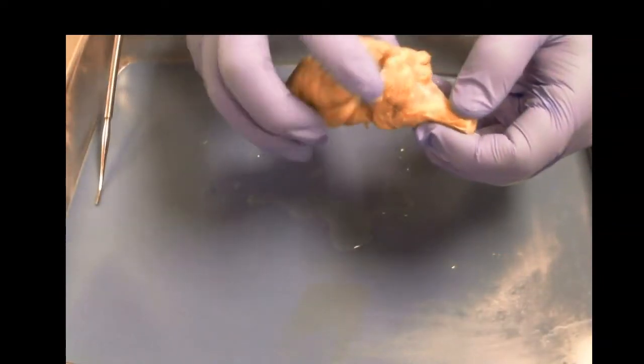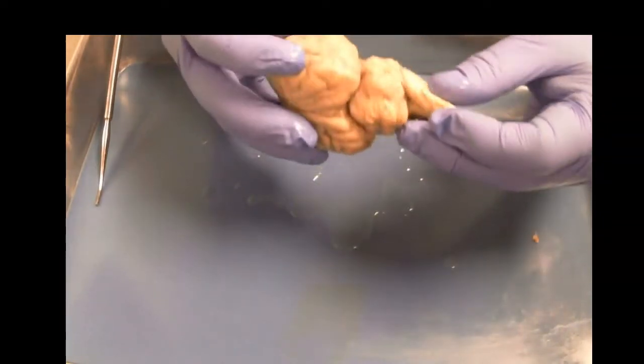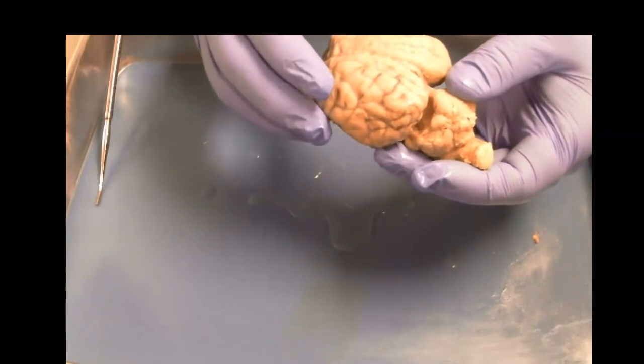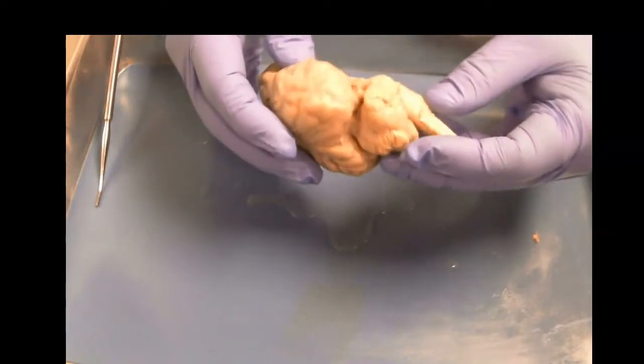Now here we have our cerebellum. We see a little bit of the pia still connected to it, the last layer of the brain, the pia mater, which is mostly removed at this point. But we know the brain has 3 layers around it. The largest, thickest is the dura, the arachnoid, and then directly against the brain is the pia. And we can still see some remnants of that here.